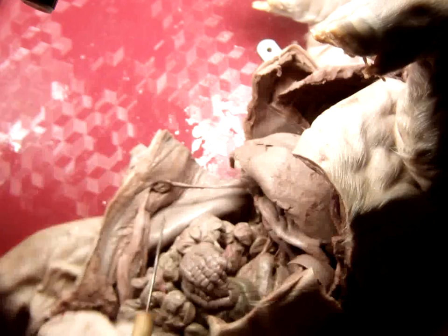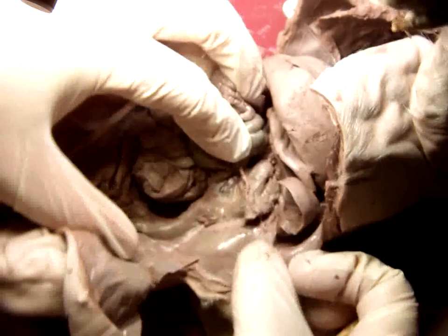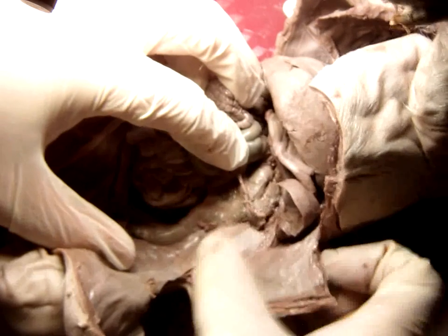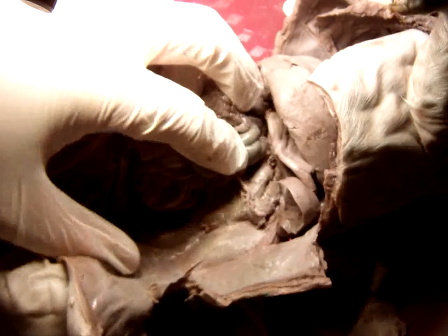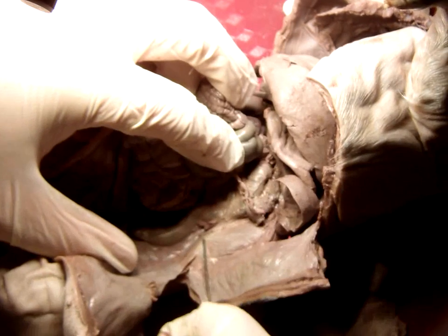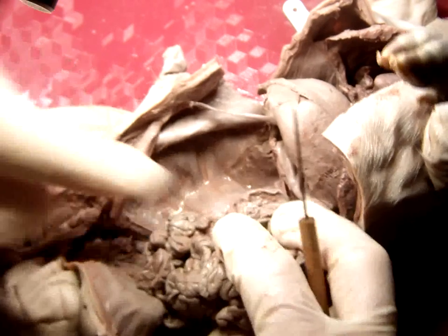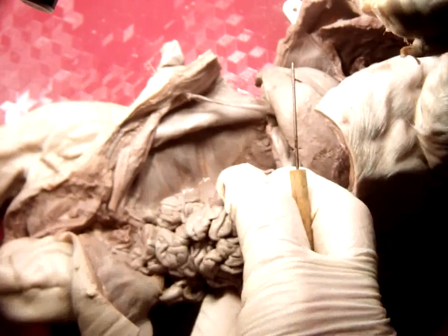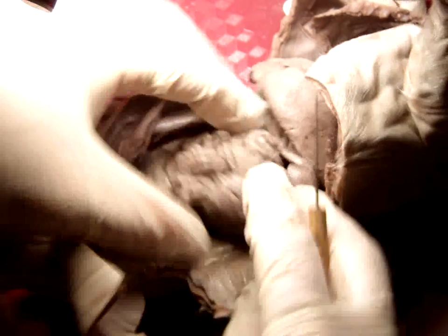Next on our list was kidneys. You'll just have to move the intestines to the side, and you'll see these lumps in the back here. And again, they're covered with the saran wrap material, layers and layers of it. But they're back there underneath that. You'll find one on each side. Here's the other one. Ours are the same way too. They're embedded in the back wall of our abdomen, covered with a number of layers of connective tissue.